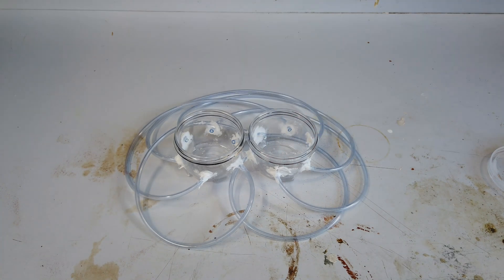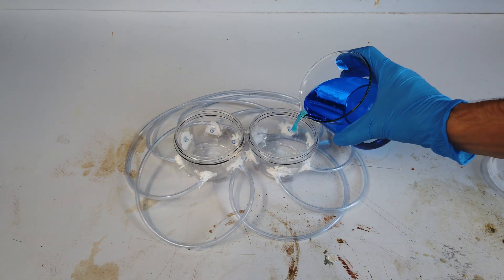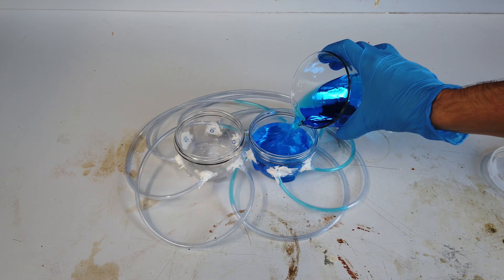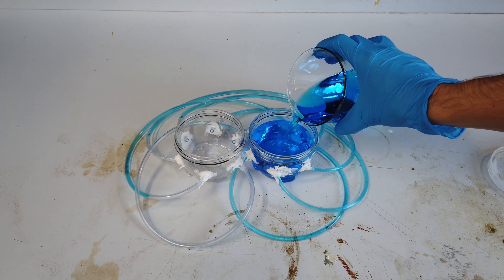Hopefully that's clear how this is all going to work. I'm sure you can tell that we are going to fill our containers with a whole bunch of copper sulfate solution.